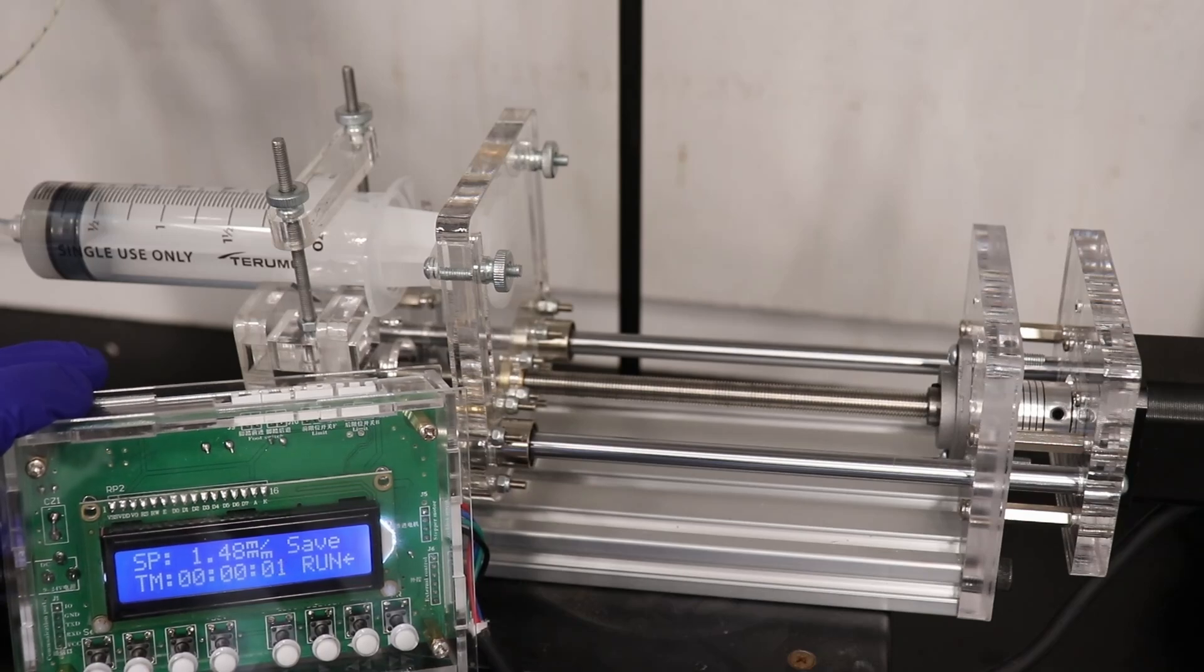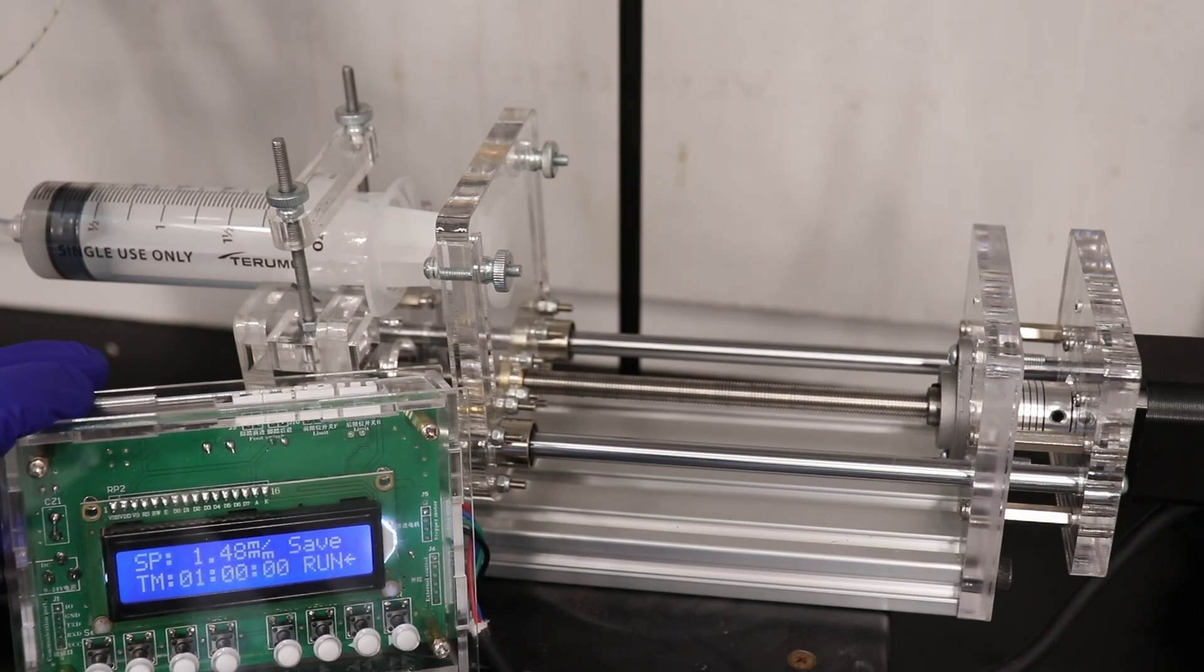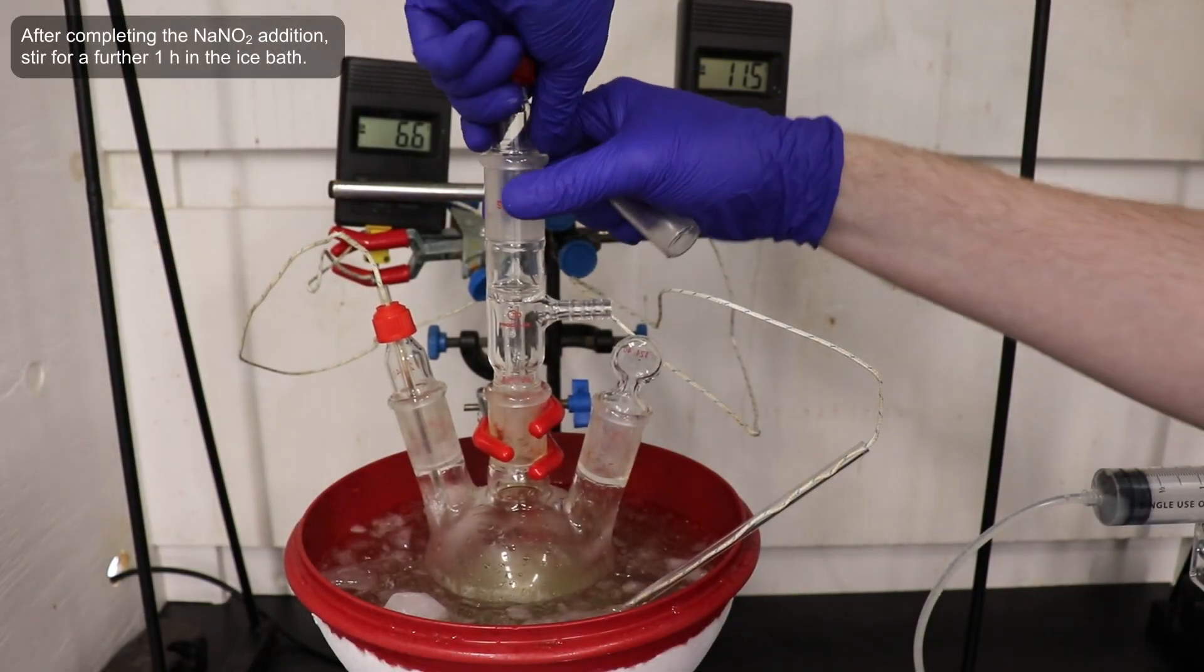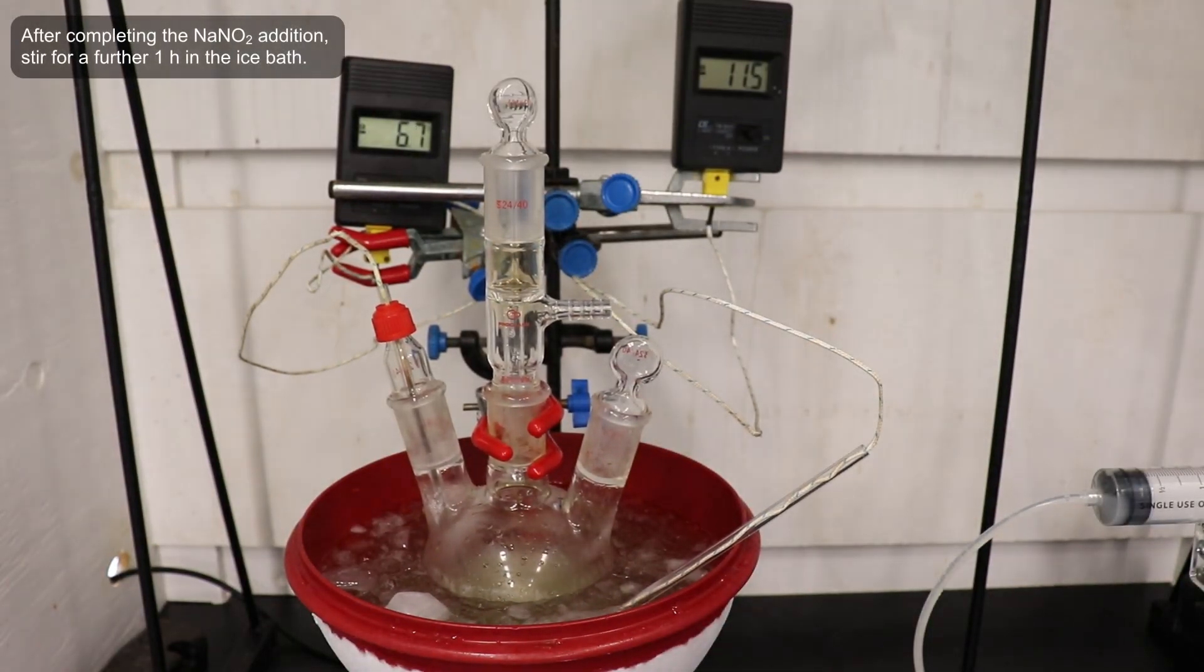After the hour-long addition had elapsed, the syringe pump could be removed. Then the next step could begin, where the solution was simply stirred in the ice bath for another one hour.